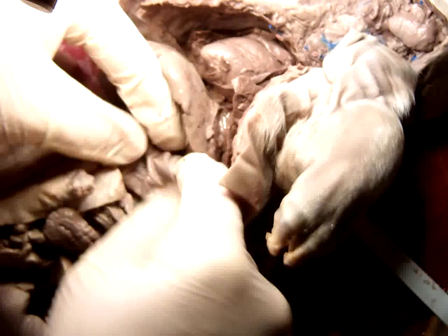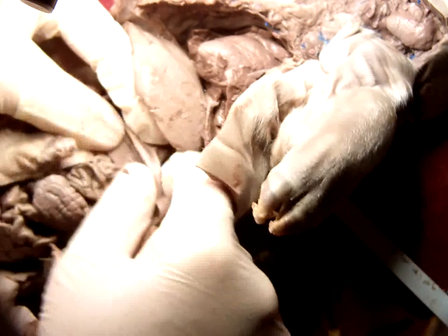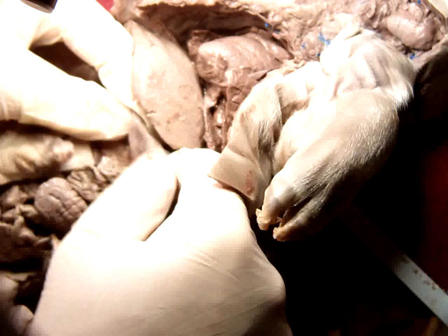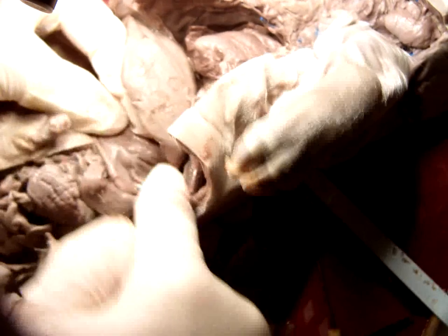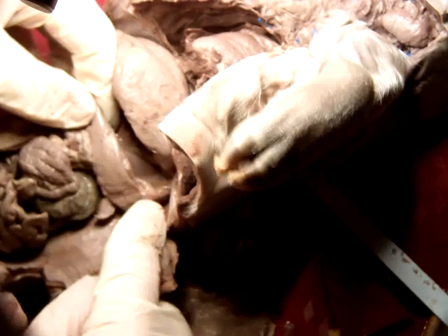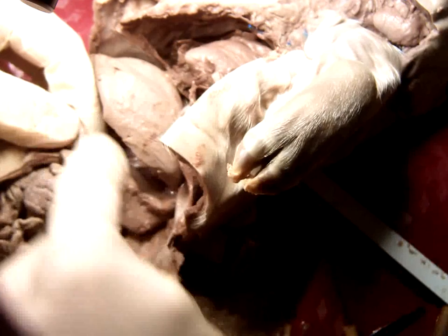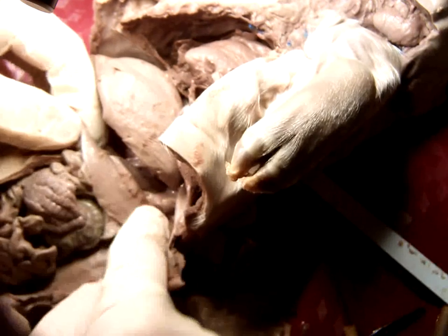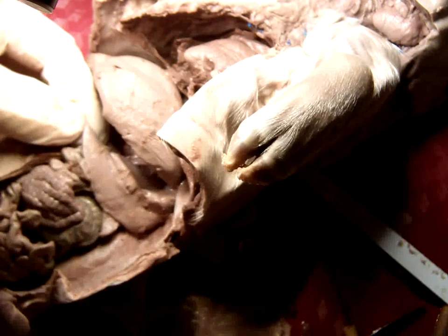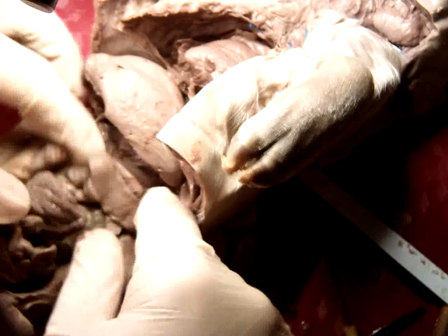Moving over this way, you'll find the stomach. It's deflated here because there's nothing in it. It can expand pretty wide and hold a pretty good amount of food. And since we're in the neighborhood here, there is this, and it's going to have more of a red color in most of your specimens. This right here is the spleen. It's on your left side. In us, it's shaped a little more like our kidneys than this long, skinny shape. But in a fetal pig, it's shaped like that.